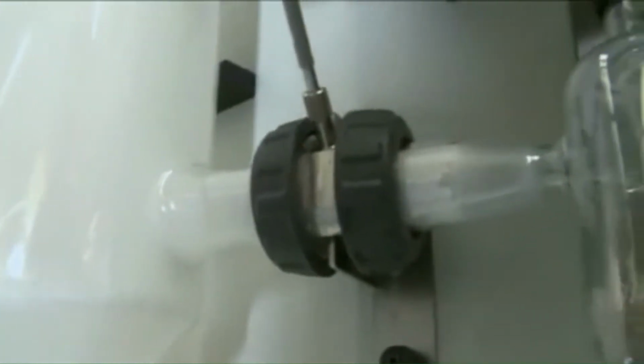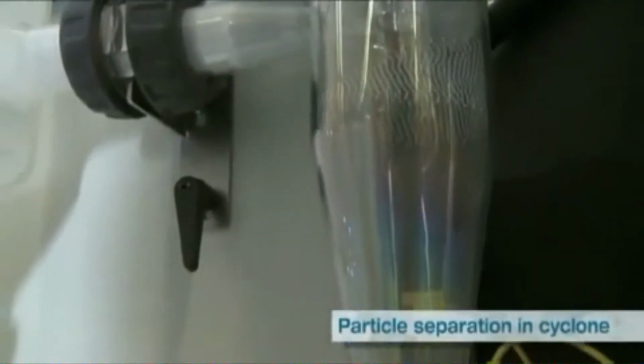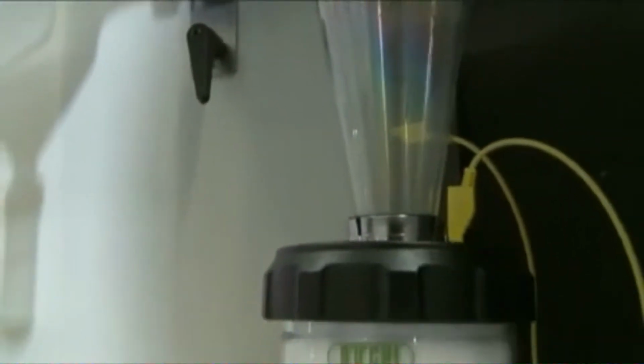And now the spray drying process will take place. The droplets will be dried out in the cylinder, then the dry particles will be transferred into the cyclone separator where they will be separated by centrifugal forces and accumulated in the collection vessel.